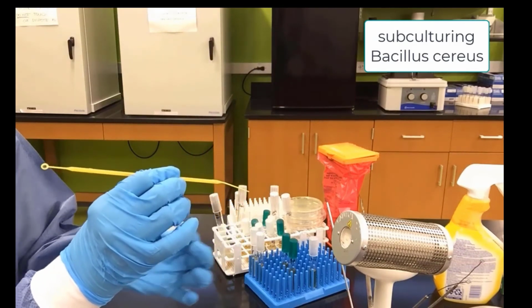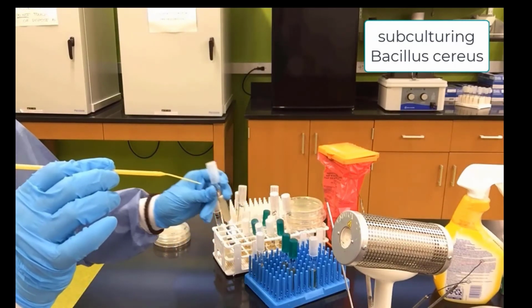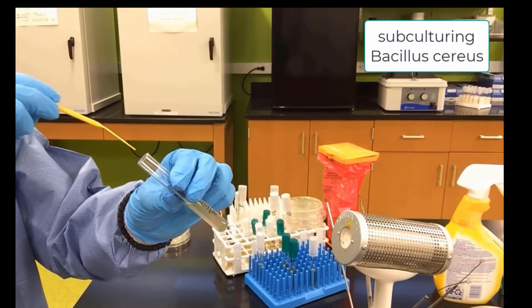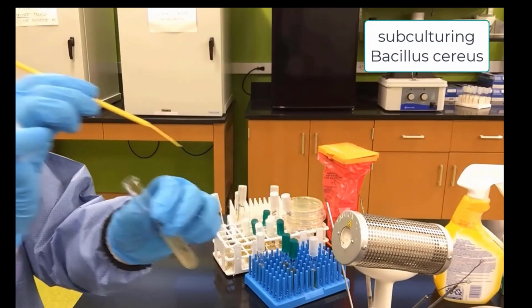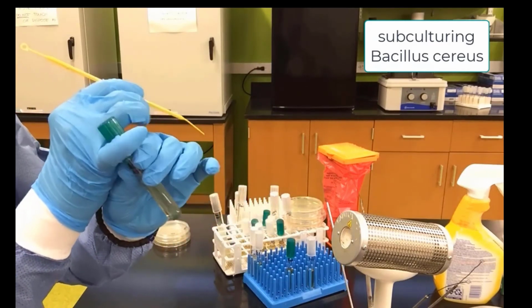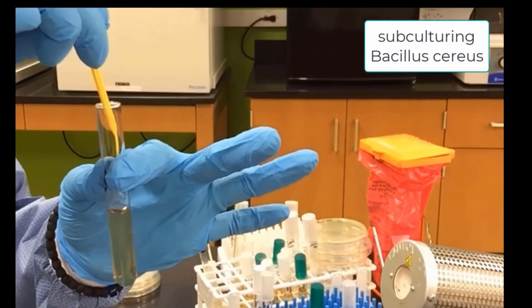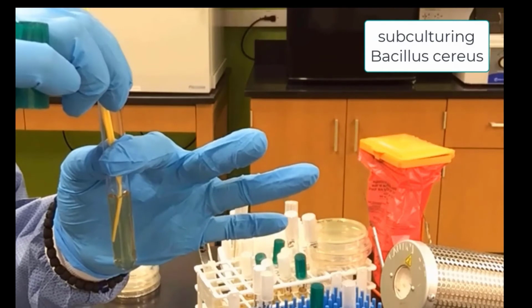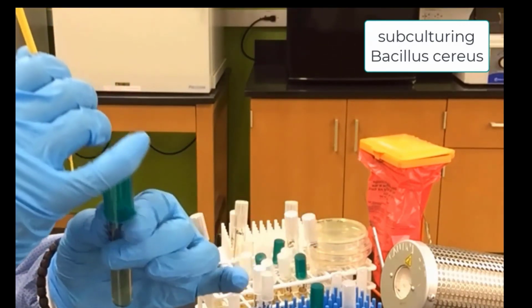Now if you'd like to save loops and not waste them, you notice there's a needle, and if I'm very careful and I turn that other end, very careful not to get any bacteria on my gloves from the loop end, I can dip the needle end into the Bacillus cereus, and I can go ahead and stab my gelatin deep. Now notice this is a little bent, so it's not going to quite be a straight going in technique. That's okay. It was a little bent there.